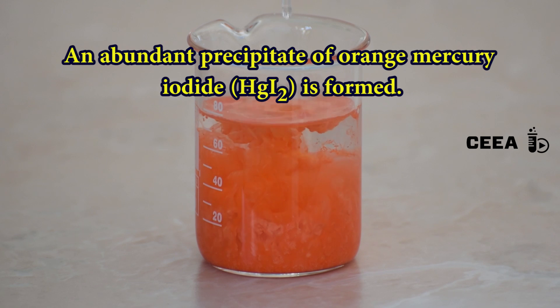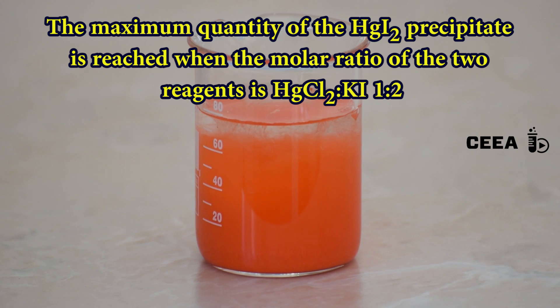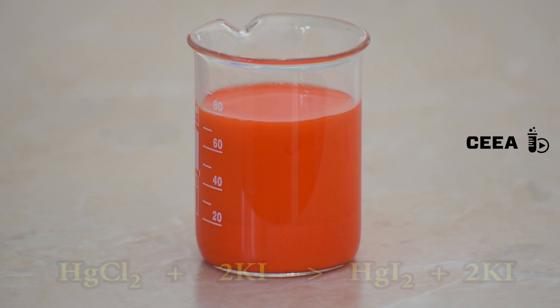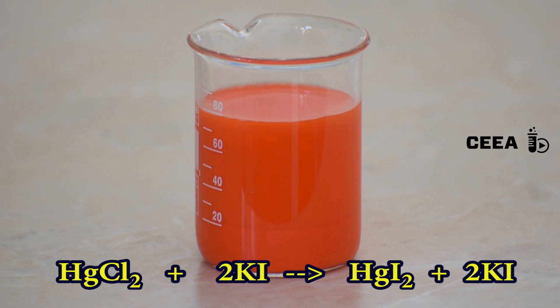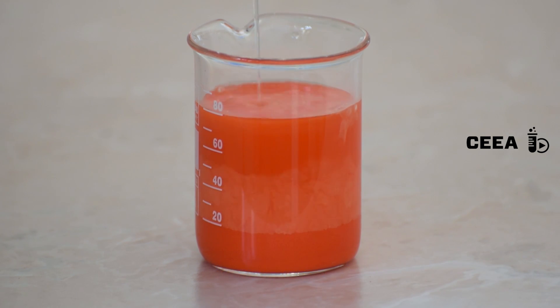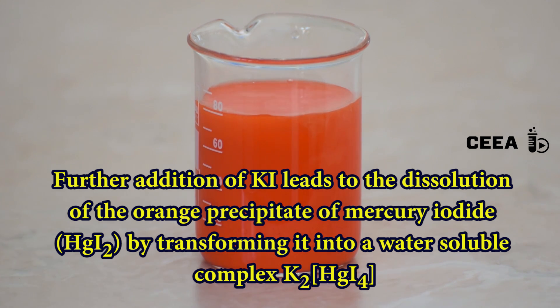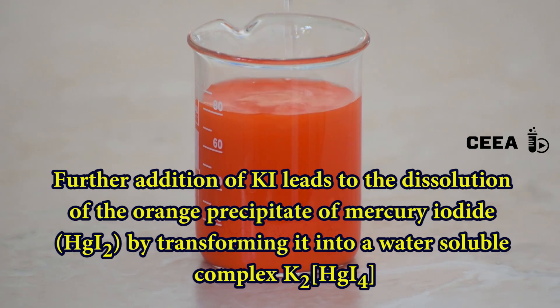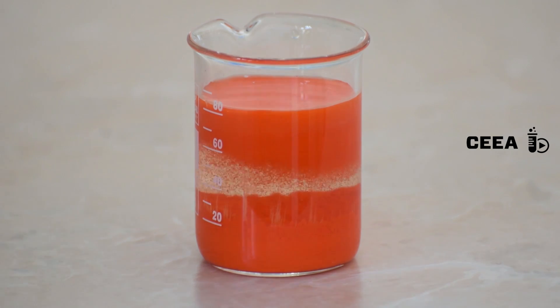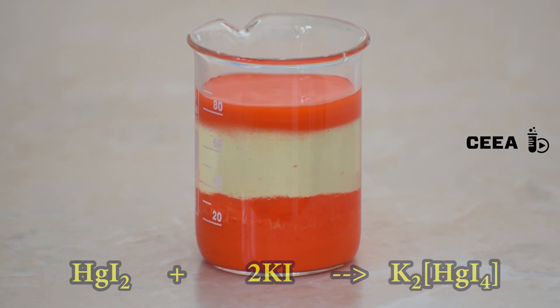We notice the formation of an abundant orange precipitate of mercury iodide. The most abundant precipitate is obtained when mercury chloride and potassium iodide interact in a 1 to 2 molar ratio. This process is a double replacement reaction. Further addition of potassium iodide dissolves the precipitate by forming a soluble complex.